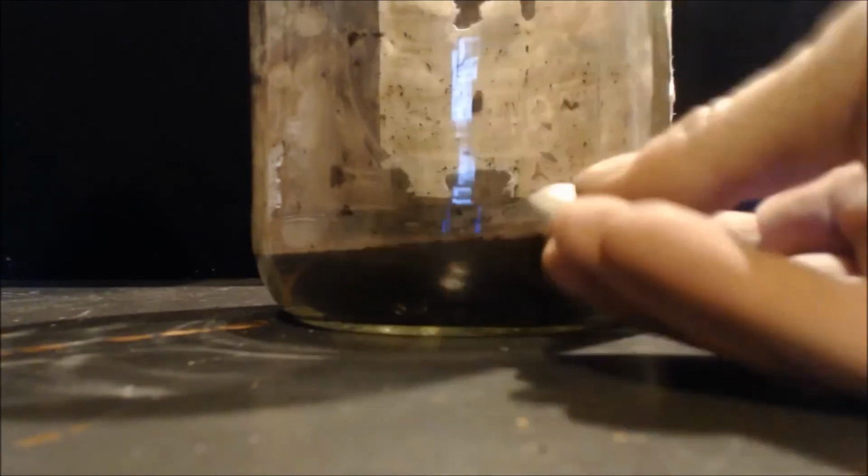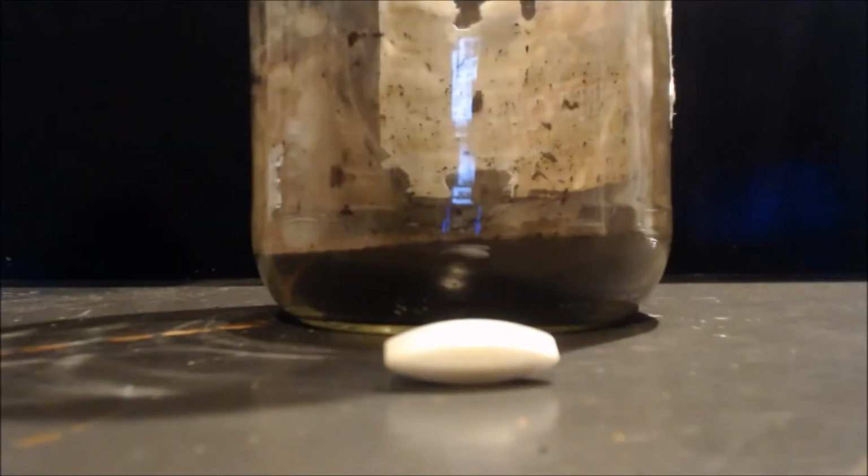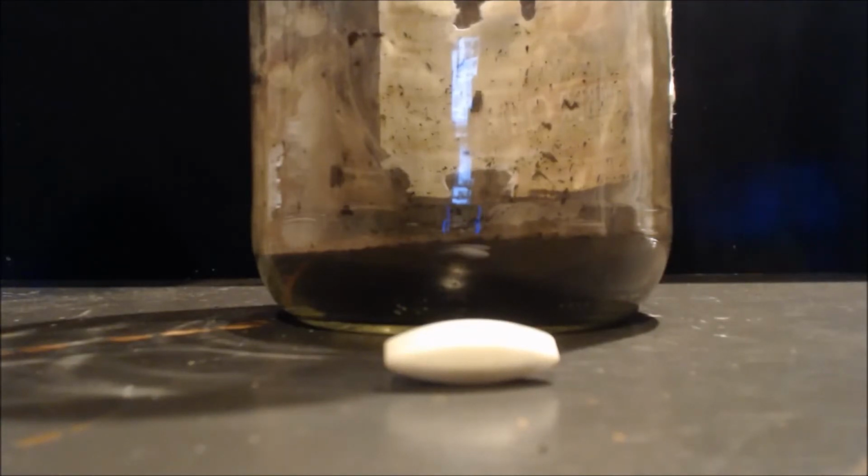But anyways, I found this one, so I'll put this in there, and I'll fill this all the way up with water. I'll spin it. First I'll stir it after I get the water in there, and let it mix up. I'll let it settle down. I will decant off the water, and then I'll use distilled water the next time, and I'll do it again.